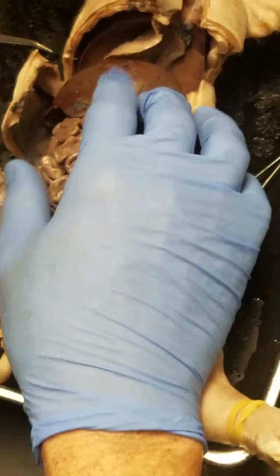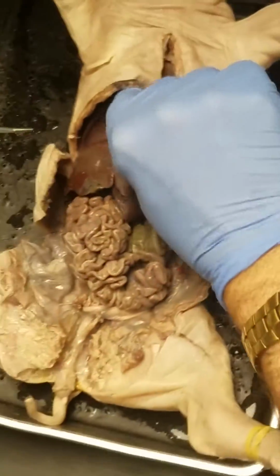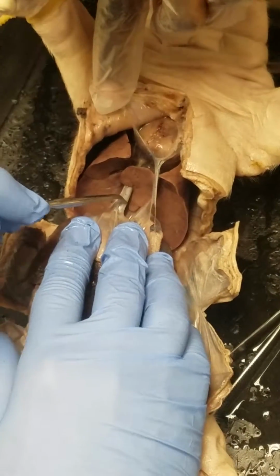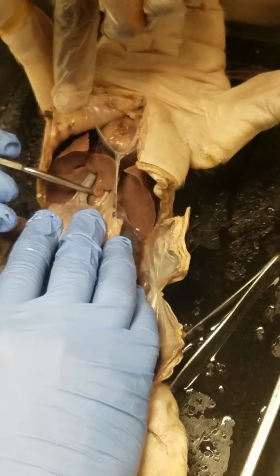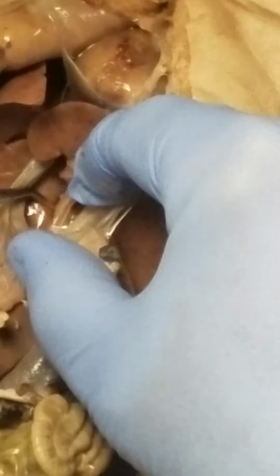What are we missing? Do I have diaphragm on there? Esophagus. All right, to find esophagus, you're going to go up. You find your inferior vena cava. And then, remember I'm looking at it from this way, you go right and down. And you'll find the esophagus right there. And of course I'll probably cut some lung out if I decide to do esophagus.